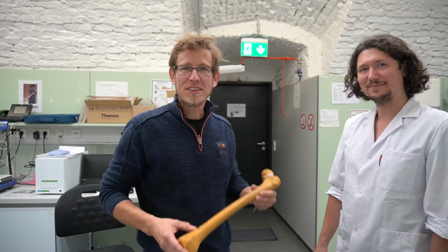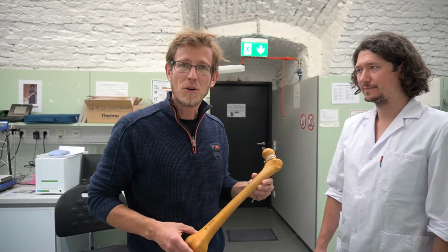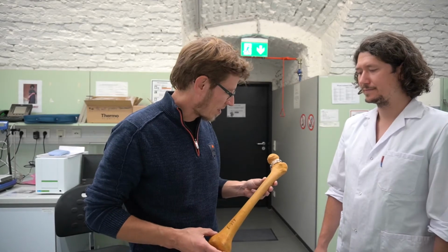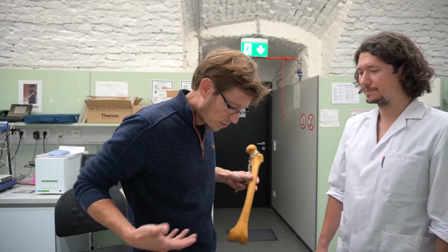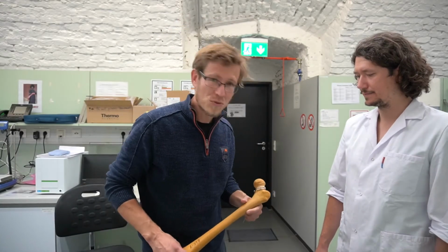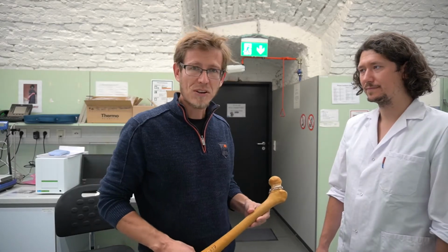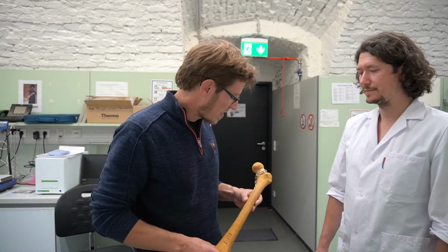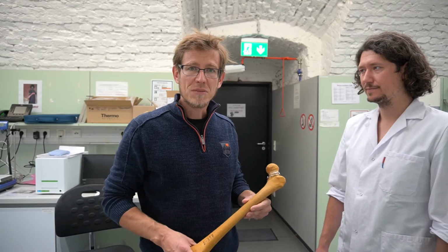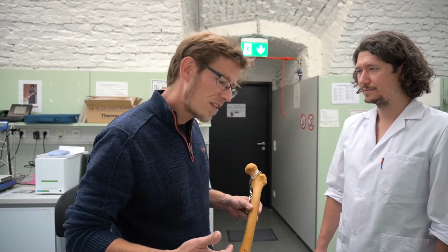Okay, what is this CortMech project about? So basically it is about the mechanical properties of cortical bone. And why is this interesting? Because the mechanical properties of bone allow us to do what we do on a daily basis: standing, running, jumping, everything we are doing in our lives. And there are diseases that corrupt these properties, like osteoporosis, where, for example, the fracture load of certain bones is decreased. And we are investigating how the mechanical properties of bone are changing, and for that we need to measure them.